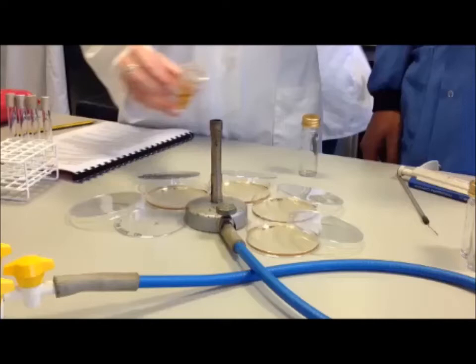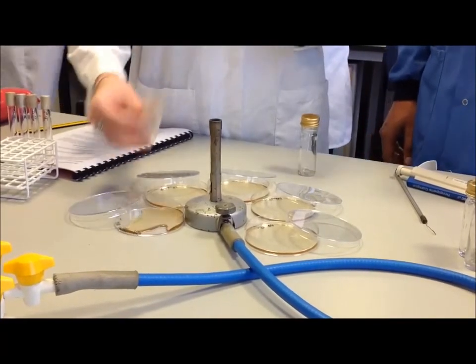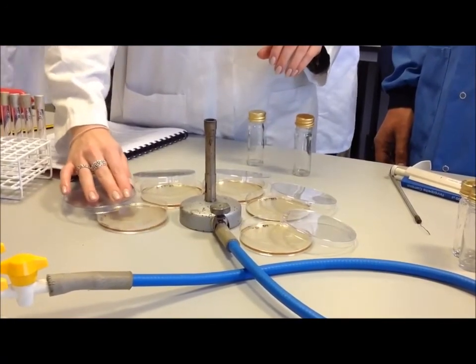So the student flames the neck of the bottle with the agar in it, pours it gently into the agar plate, and then mixes using a side-to-side and backwards and forwards motion.